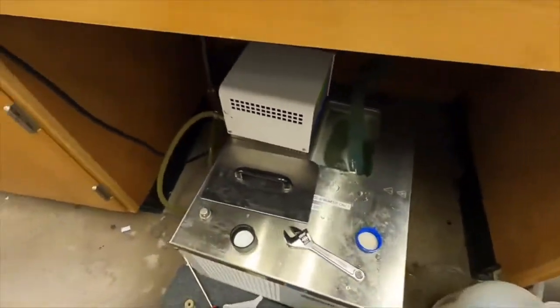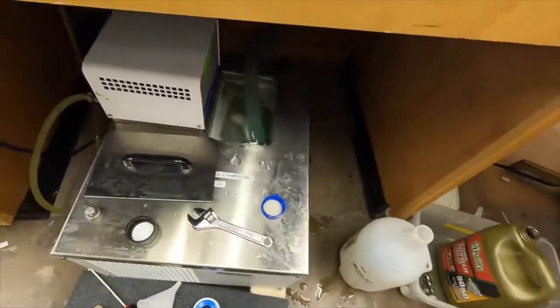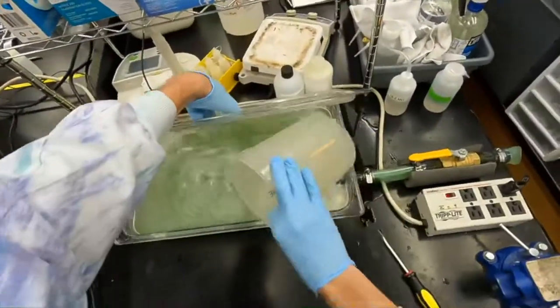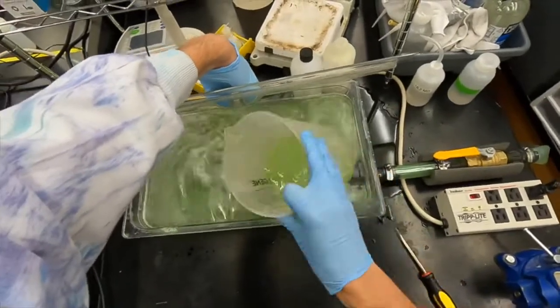Usually as it kind of warms up, the levels will kind of change. If you accidentally overfill it, which is pretty easy to do, I usually just take this bucket here and you can just open it up and dunk it in here to remove some of the volume so it's not overflowing.